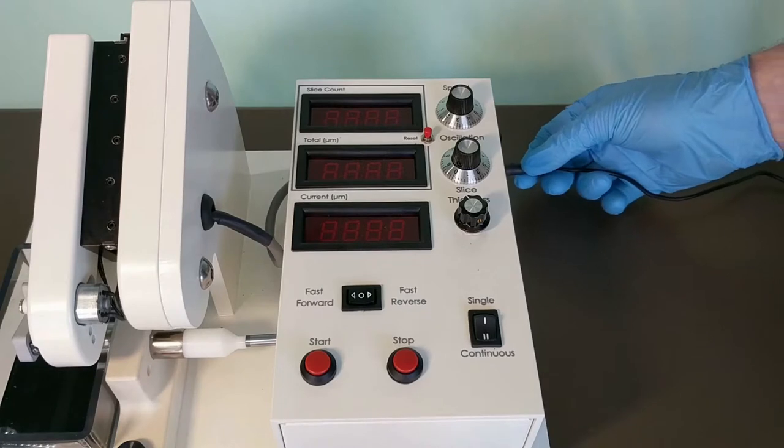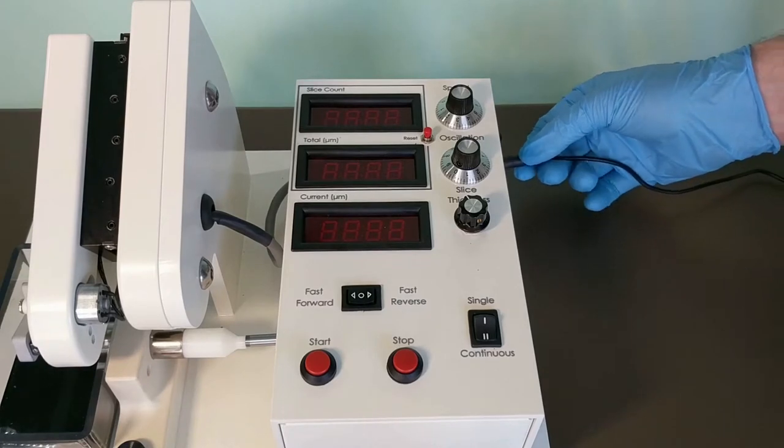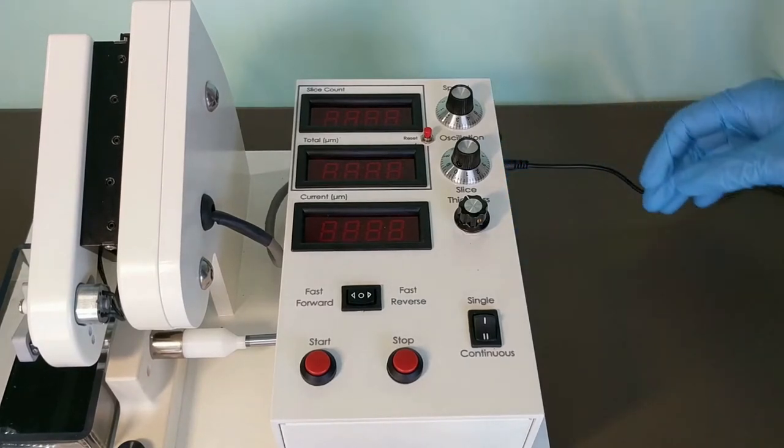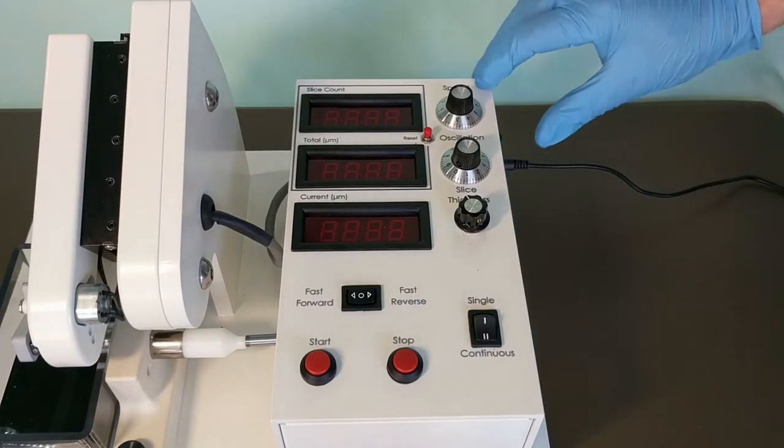To start, plug in the power cord and turn on the instrument using the power switch.